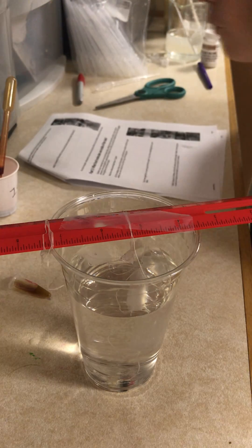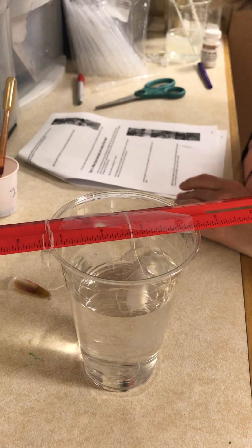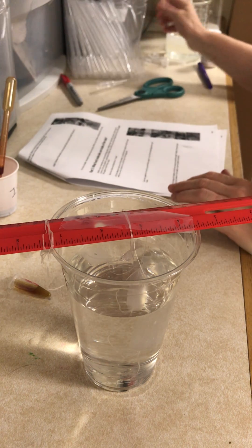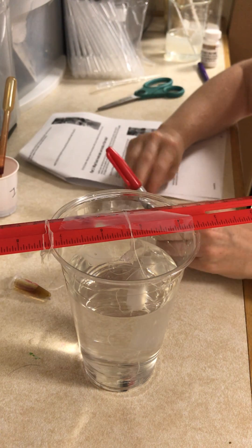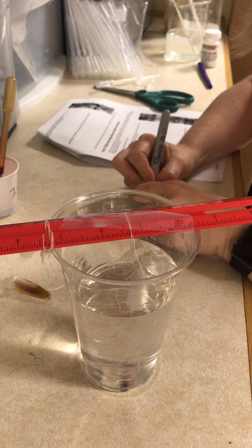I'm now going to test what food molecules are inside the tube. I'm going to follow the same procedure but this time I'm going to use the liquid that is inside the dialysis tube.